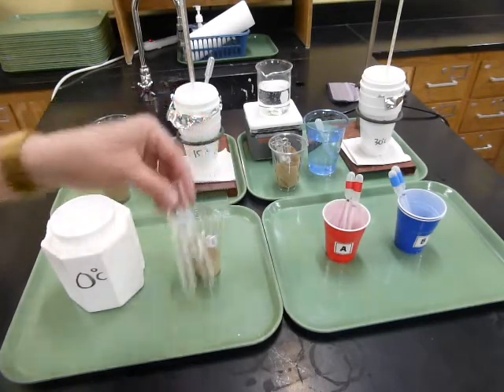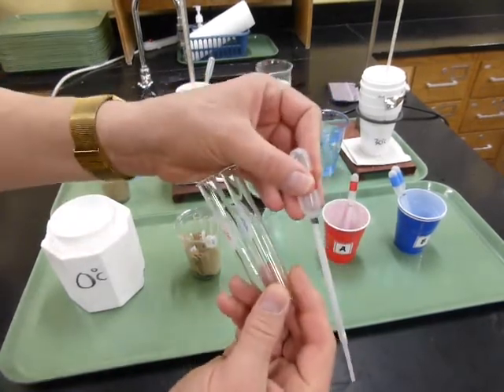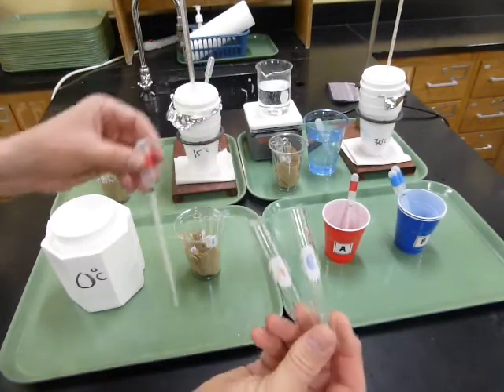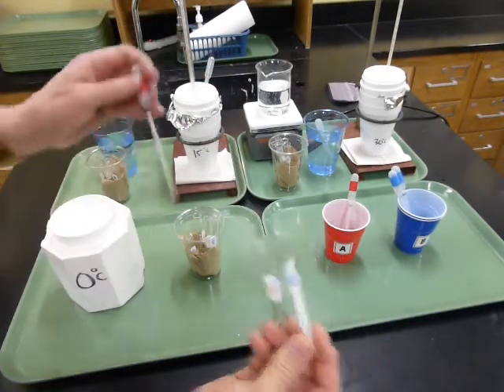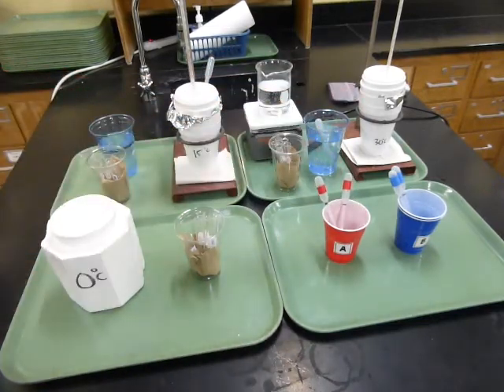We're going to use the pipettes to measure very carefully up to the line for each 1 milliliter, so that you're putting 5 milliliters of the A solution in the A tubes, 5 milliliters of B solution into the B tubes. So someone could be working on that, while somebody else is working on getting the temperature of each of those 3 water baths to be at the right temperature.